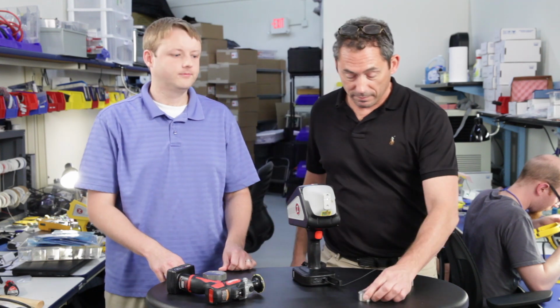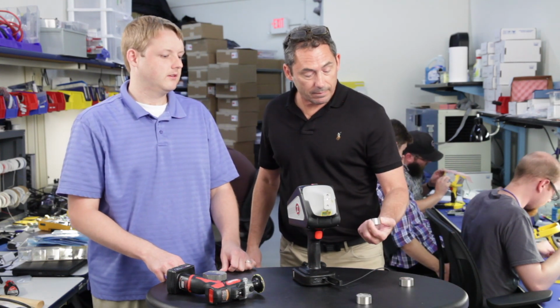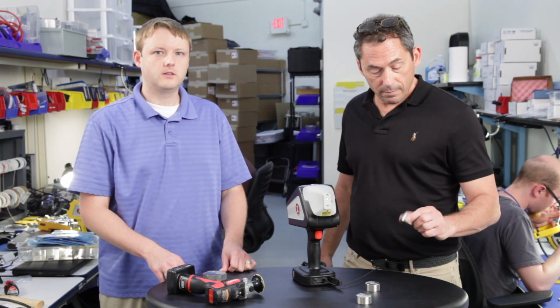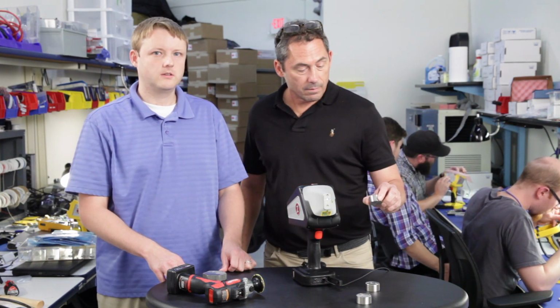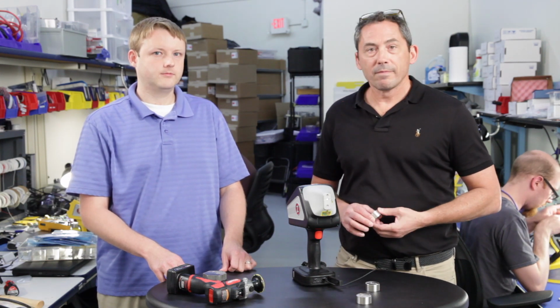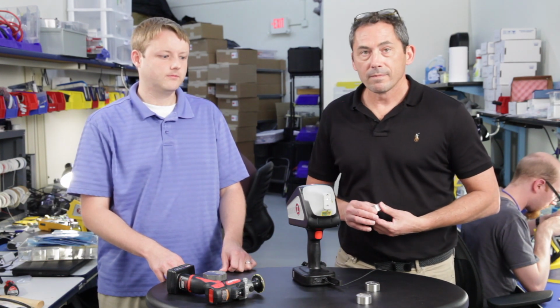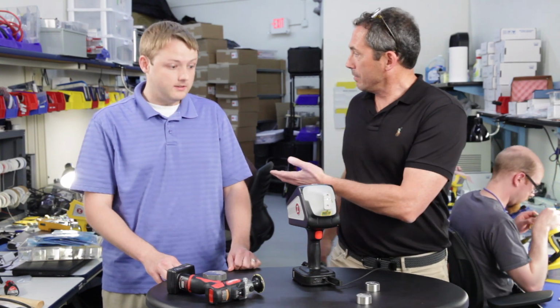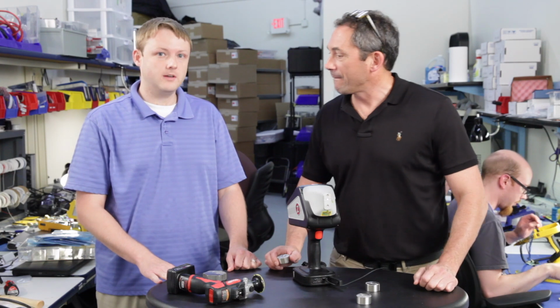Question. So, is it really that important to do evacuation for the argon before you get started? Is what you're testing here so difficult to measure that all these preparations are necessary? Yes. Would you agree with me? Yeah, definitely. It's really low carbon concentrations.